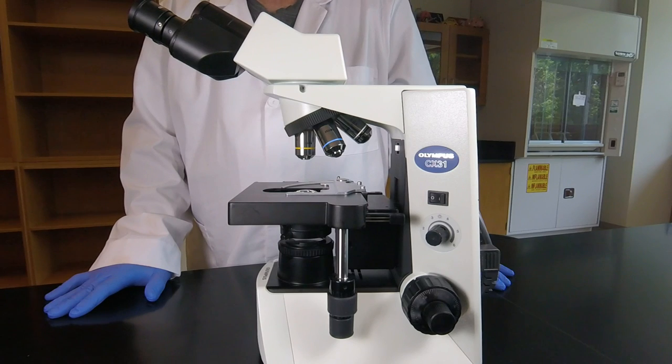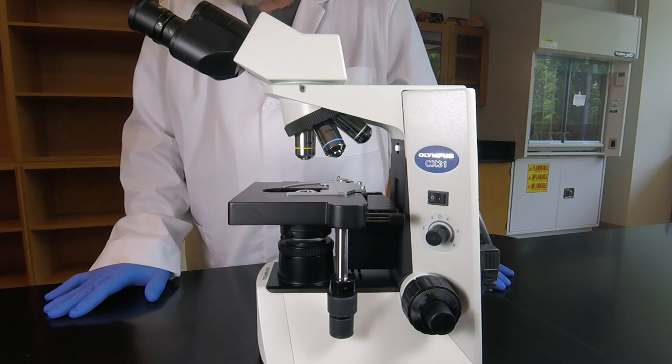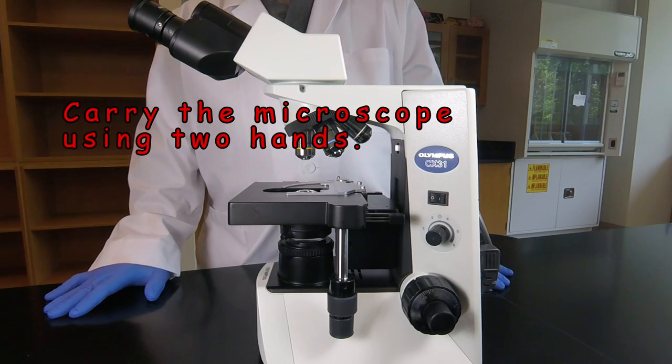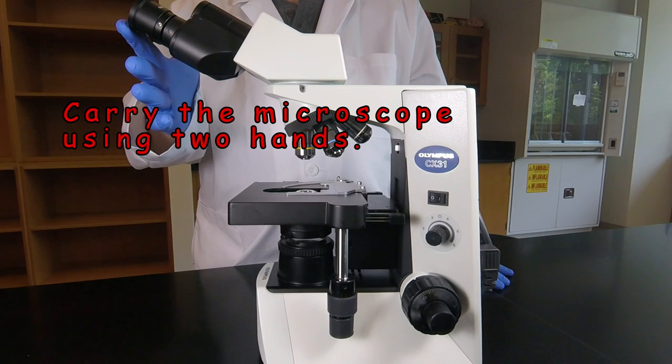Now, before we get started, I first want to show you how to handle the microscope, how to pick it up when we're ready to carry it. When they're in the microscope cabinets, the eyepieces will be facing you.